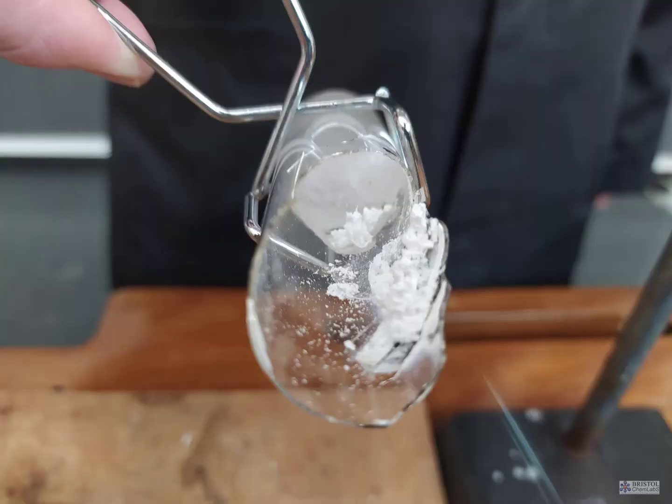Cold water and glass causes cracks and sometimes can cause the tubes to shatter. Students should be aware of this. The simple remedy is to take the tube out of the water.